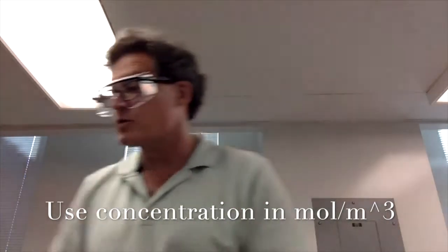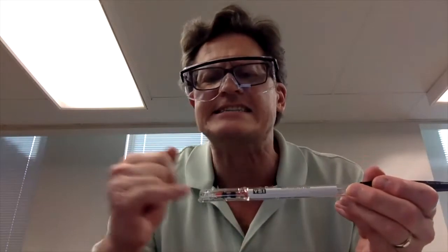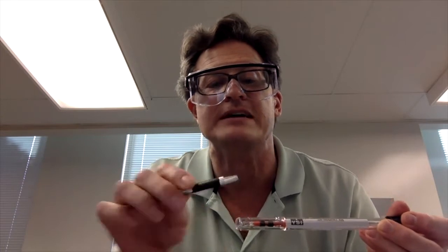Okay, what are we going to do? We are going to use this conductivity meter, which has a probe that looks like this. It's a glass tube, and inside the glass tube, this is really important, there's a little coil in there, a wire of metal. That is what does the measuring. It's actually on the inside, way up about here. It's not at the end of the tube. It's not on the outside of the tube. It's inside, right about here.